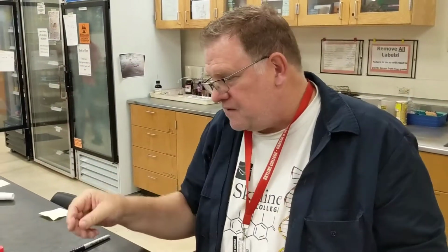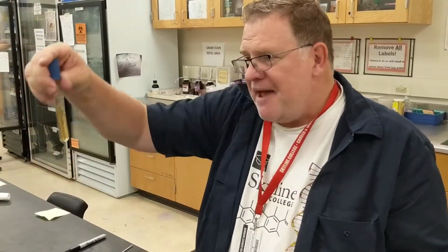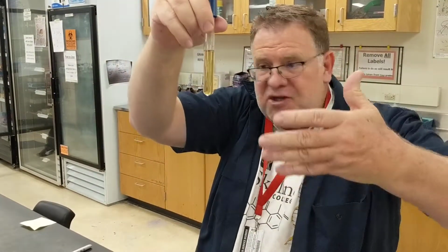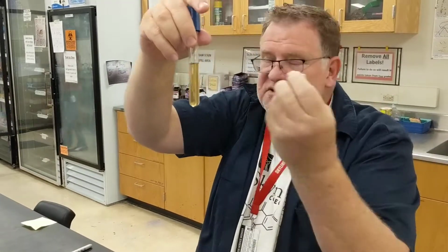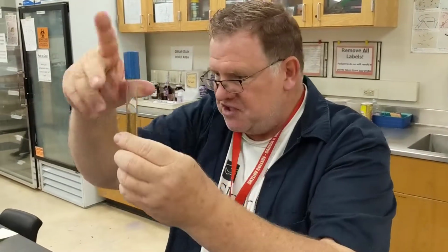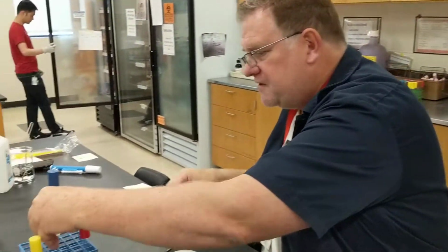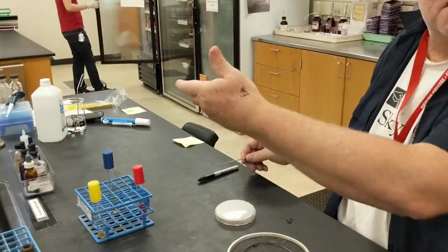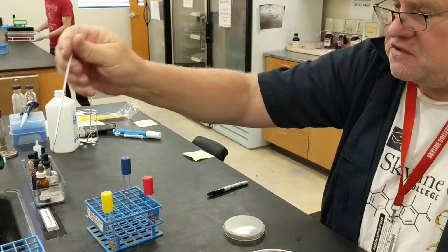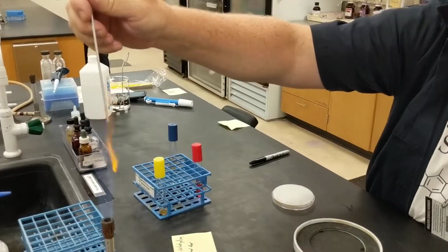So I have my culture of bacteria. Some of the things that I'm going to do with this culture is use gelatin. If you look at it, you see the gelatin is solid. That's due to the matrix of the protein molecules in there that make the gelatin. What you're going to do with the gelatin, it's in a format that we call a deep. What you're going to do is take your culture from a tube.